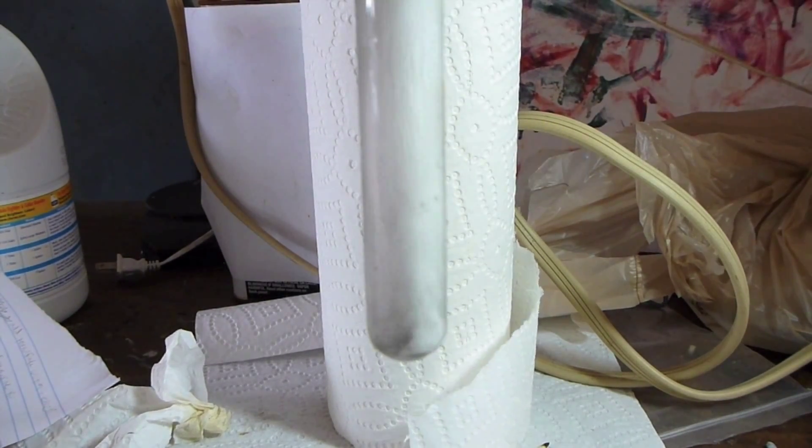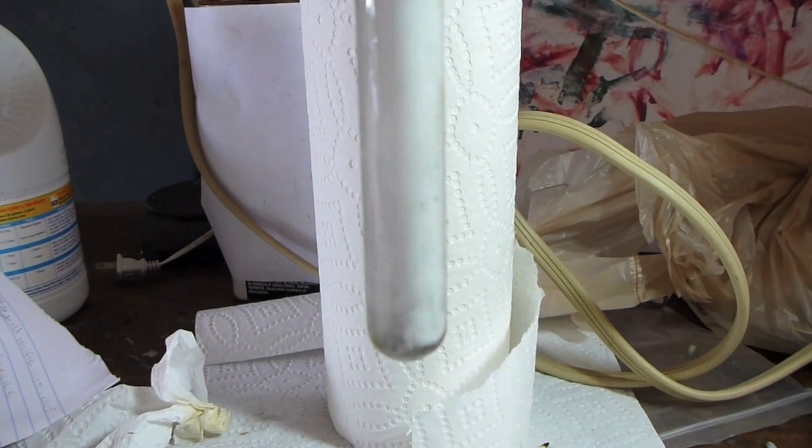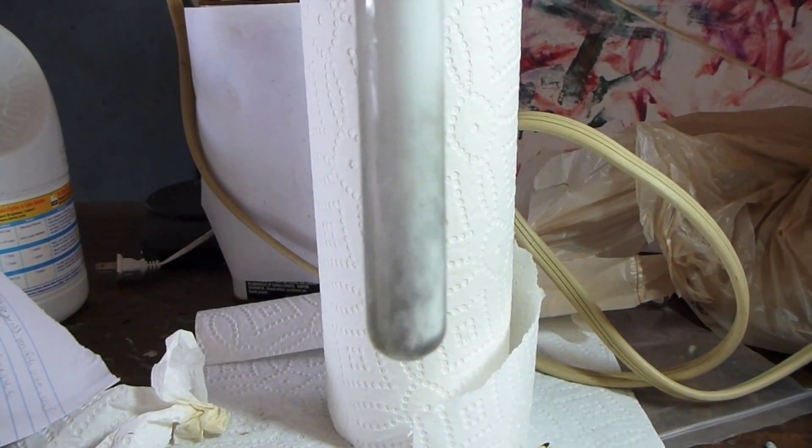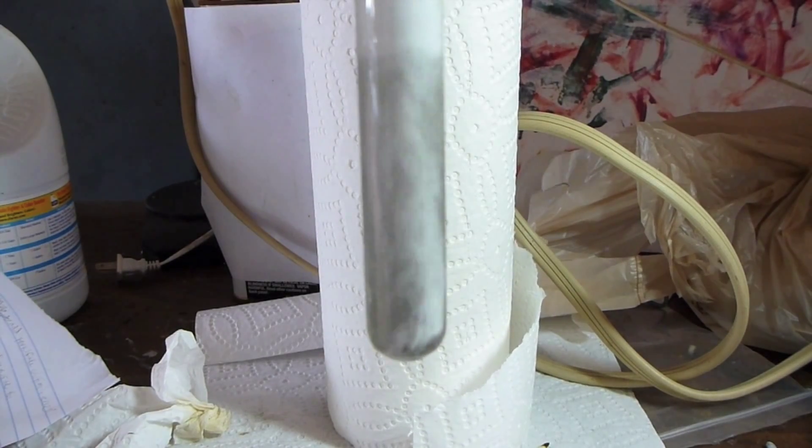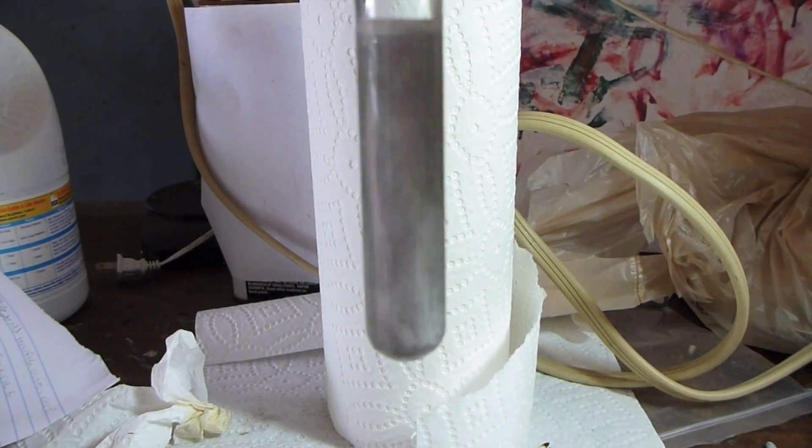Well, why is the solution so light? Because it's much more dilute than my previous ruthenium tetroxide solution. And most of the ruthenium tetroxide has by now escaped as a gas. So there we go. We've now observed all of the relatively easily accessible oxidation states of ruthenium.